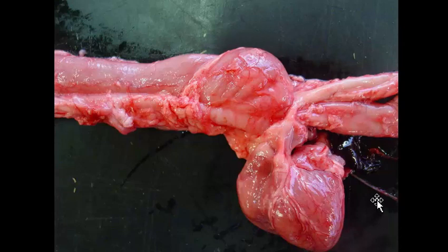Okay, it is tissue from a dog, and you can see that the ligamentum arteriosum is very prominent. It is stretched across the esophagus. There is some bulging of the esophagus in the proximal area, so the head is going to be up here. Okay, it's a classic lesion, and I prefer the term vascular ring anomaly. Some people call it a persistent right aortic arch. That's perfectly correct, but then you sort of have to understand the mechanism of how this works.